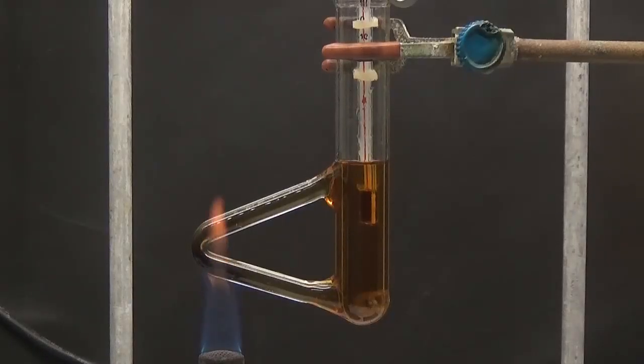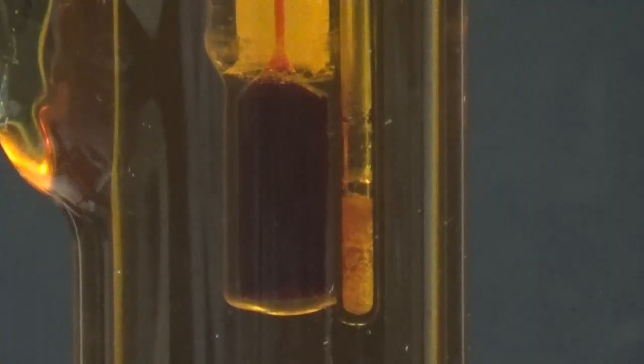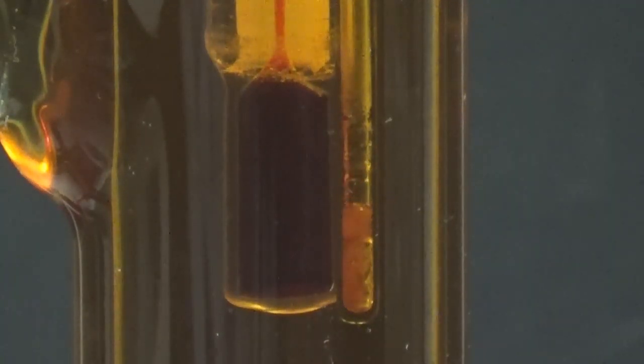Collect the crystals and dry them in a 100°C oven. In our test, the melting point was 187°C.